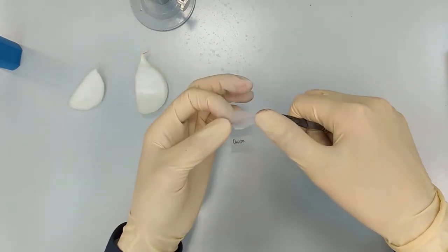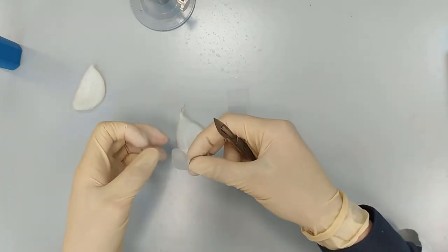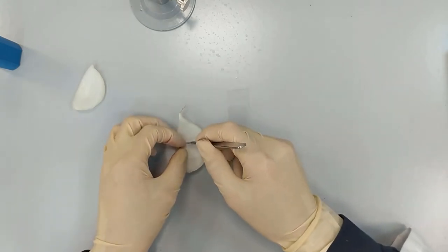So now we have this sheet of onion cells, and let's make it squared.